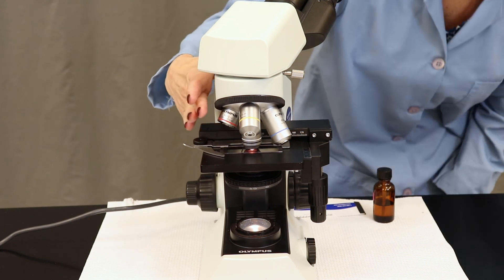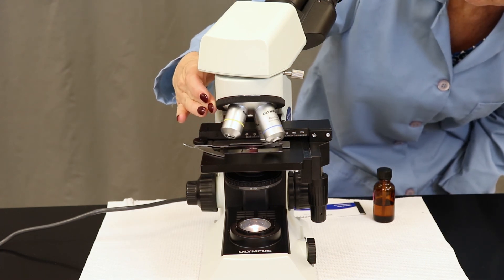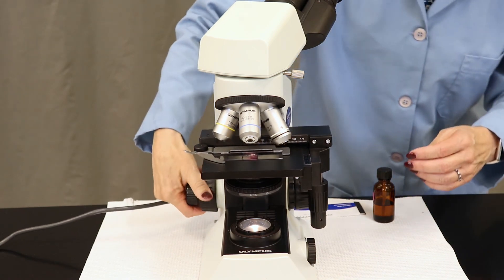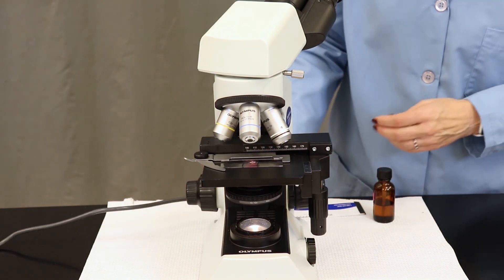When you're finished viewing your microorganisms under the microscope, use the nose piece and get the 100x out of position. Next, lower the stage to its lowest position.